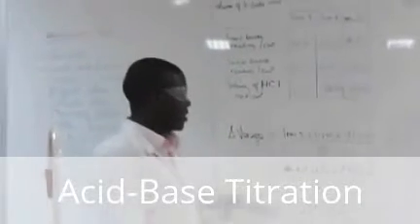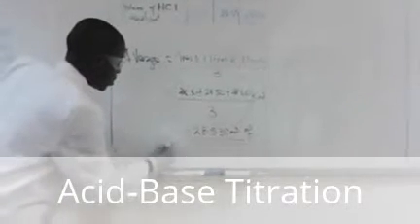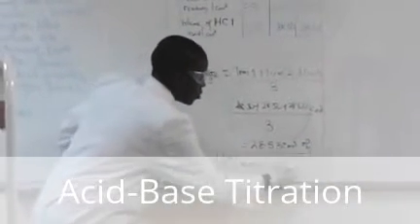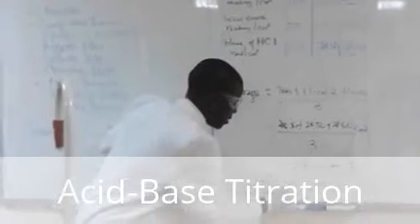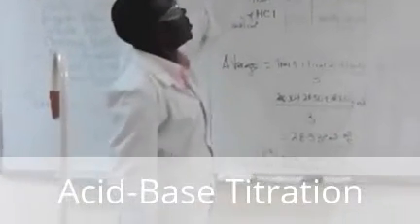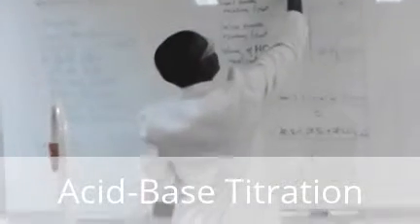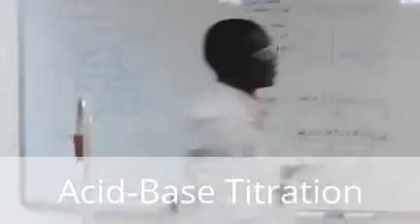So this is cubic centimeters of hydrochloric acid used to neutralize the base. Okay, so remember, the volume of the pipette used to pipette the sodium hydroxide was 25.0. That is what we pipetted into the conical flask.